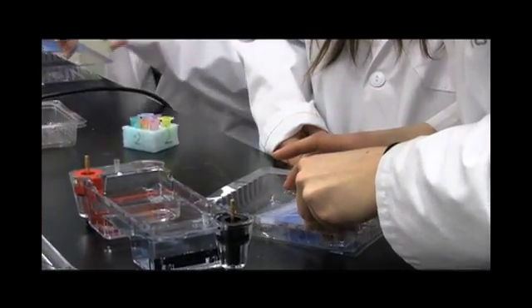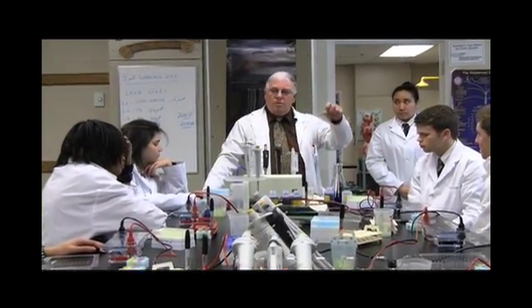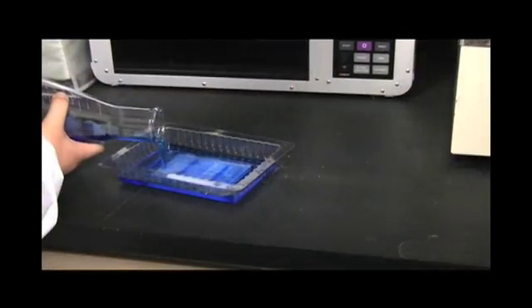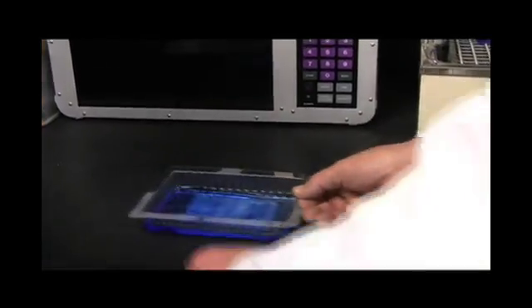We'll slide the gels into a tray to stain overnight. We'll flood the agarose gel with the stain and put it on a shaking platform.